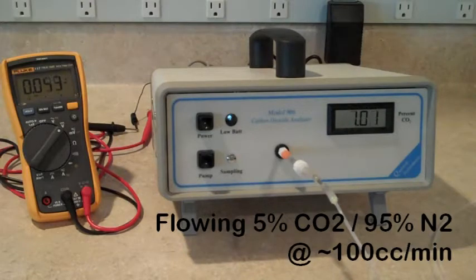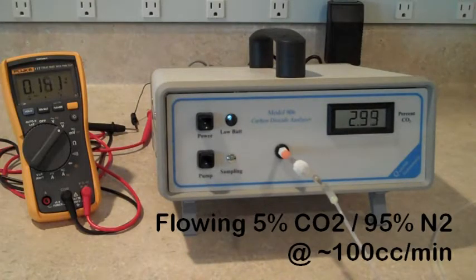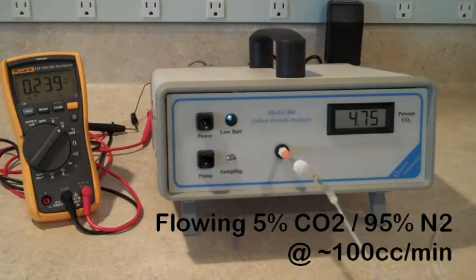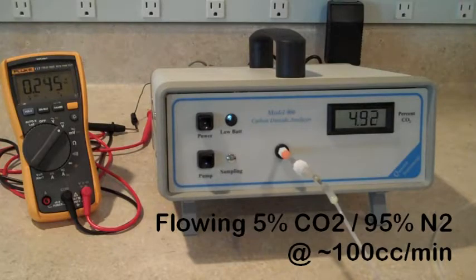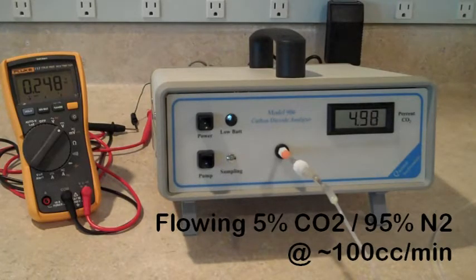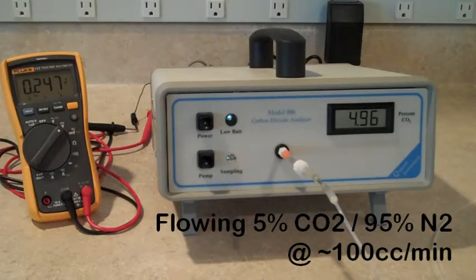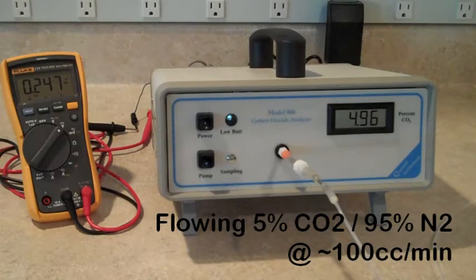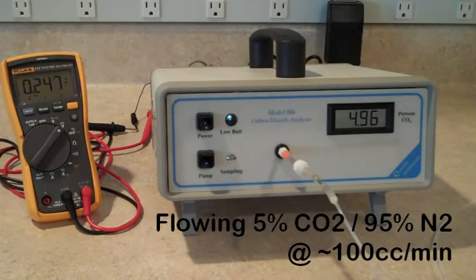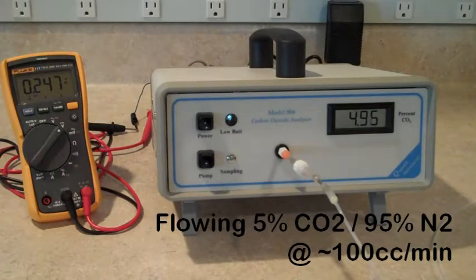We're going to start by flowing 5% CO2 through the analyzer at a flow rate of about 100 cc's per minute. We recommend flowing your gas at a rate of 10 to 1,000 cc's per minute, although higher flow rates will not damage the internal sensor or the analyzer, it may produce a pressure effect on your readings.